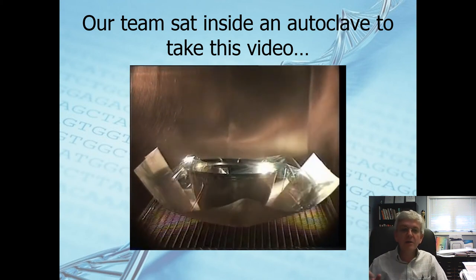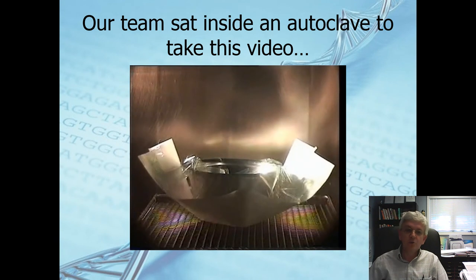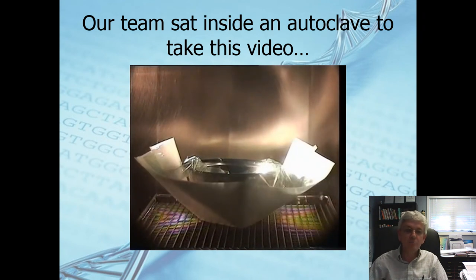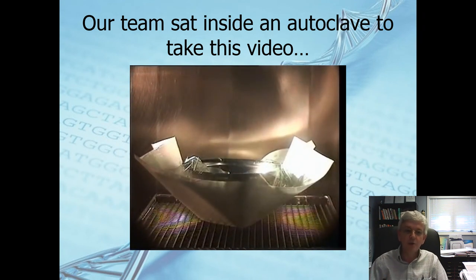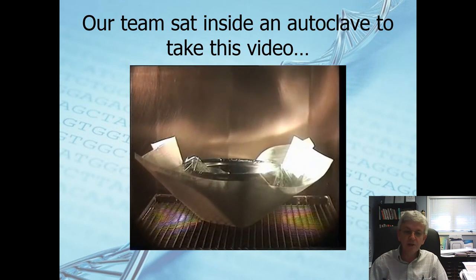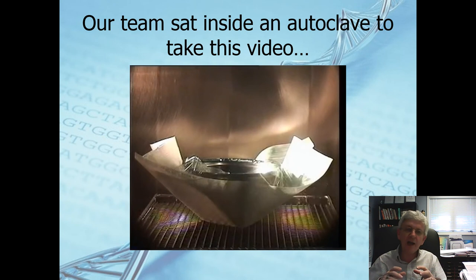Now what's happened? Vacuums come in. Look at this thing now. It is just absolutely going down, vacuuming this out. It's drawing this thing in. This bag and the plastic in this goes back and forth through several cycles just like this.